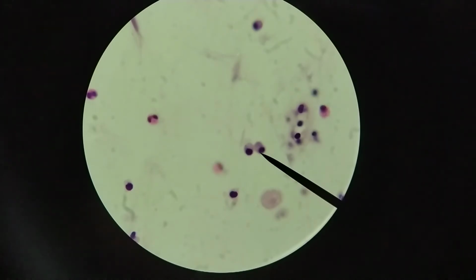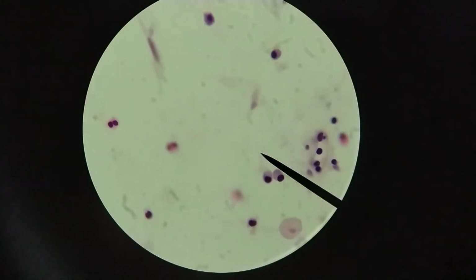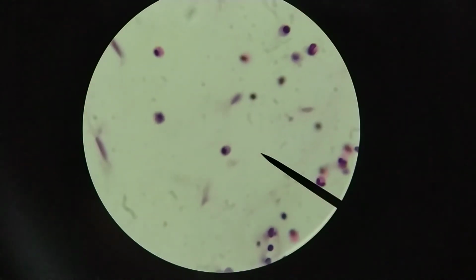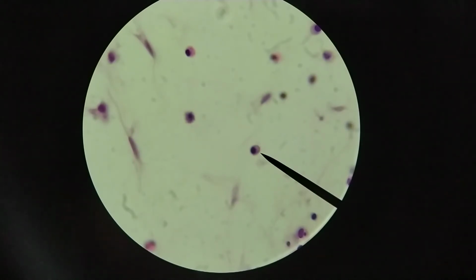Again, we're looking at a very basophilic cytoplasm in both cases and eccentric nucleus. Again, that cytoplasm is filled with rough ER, which is why those ribosomes in that rough ER are staining with a lot of hematoxylin. And that's why this cytoplasm looks very basophilic. Here is another example of another plasma cell. You can see a nice eccentric nucleus, and there's this very thin light staining region right next to the nucleus, between the nucleus and the cytoplasm. That is the negative Golgi image.